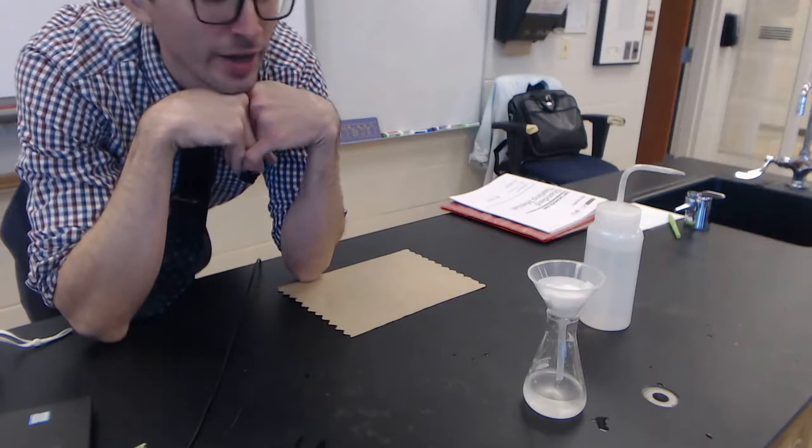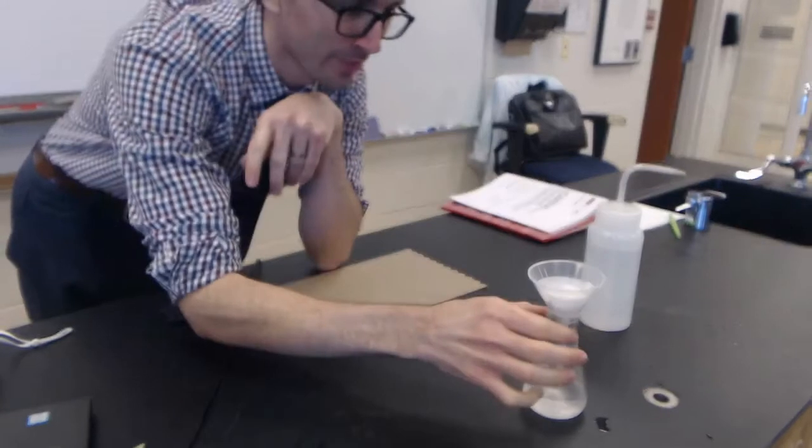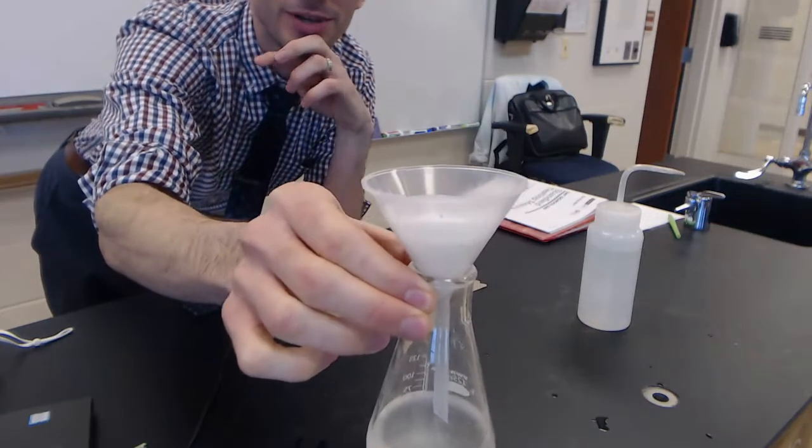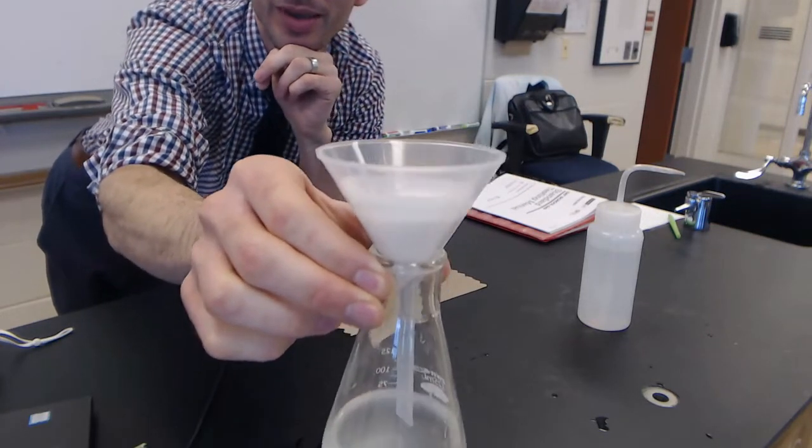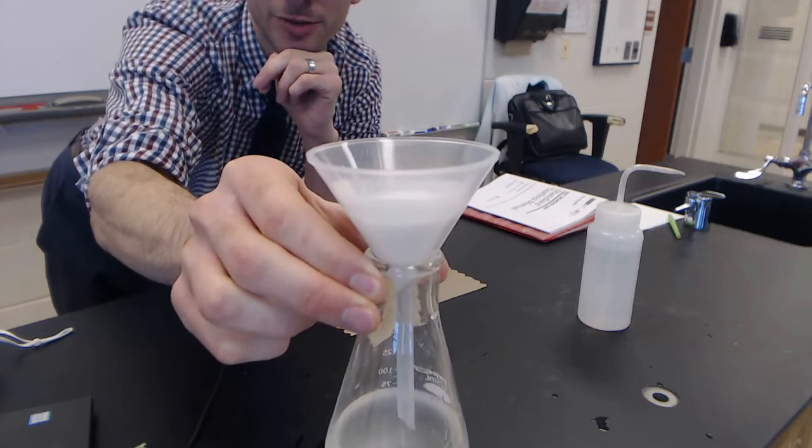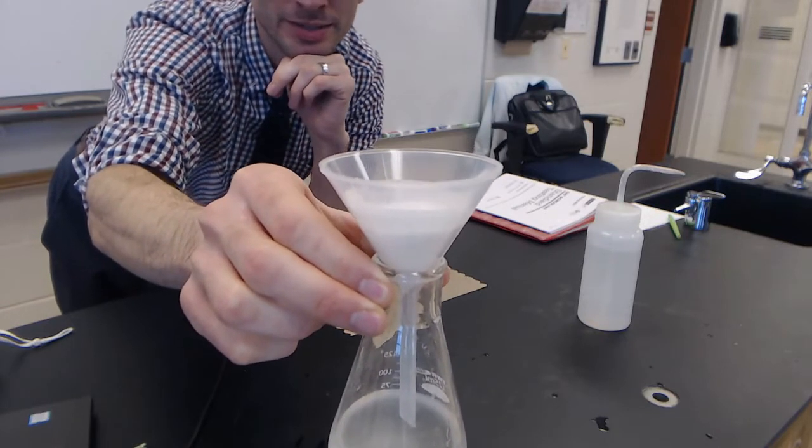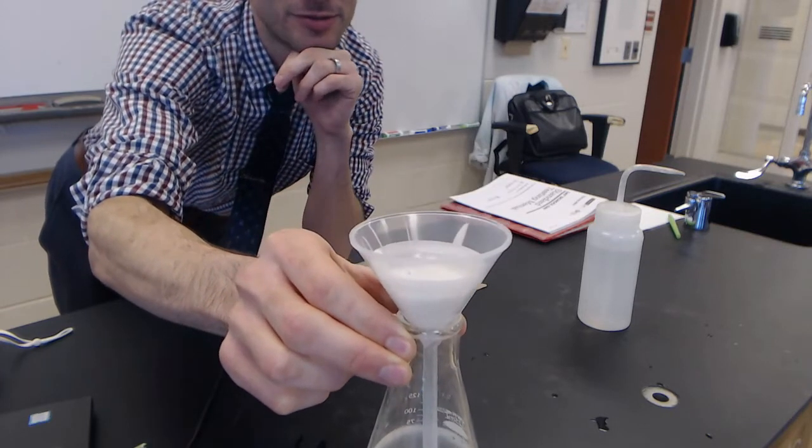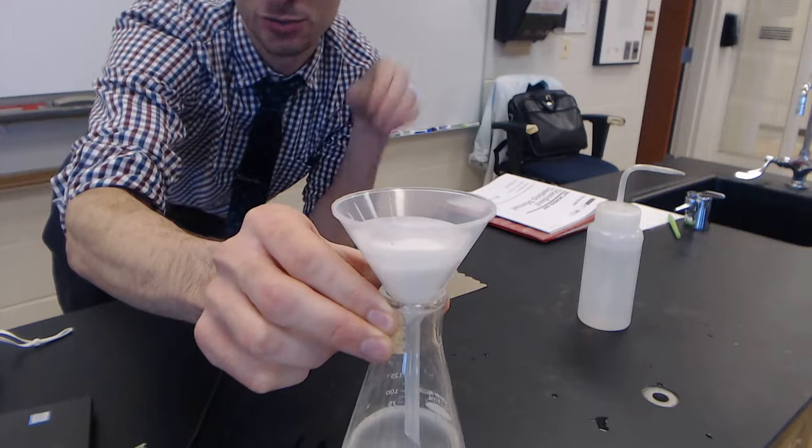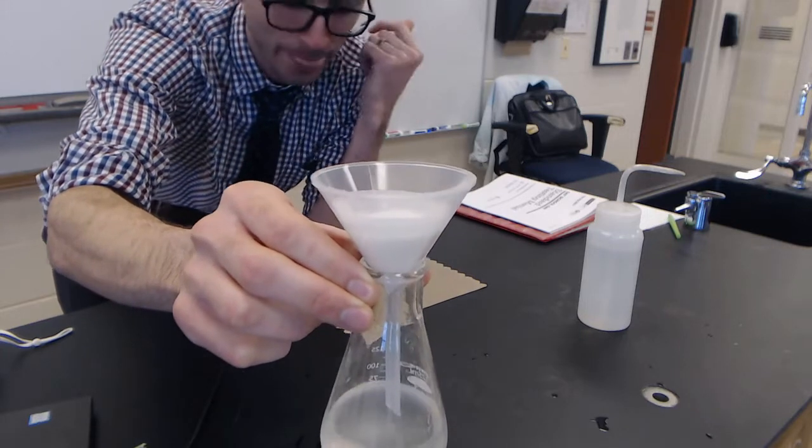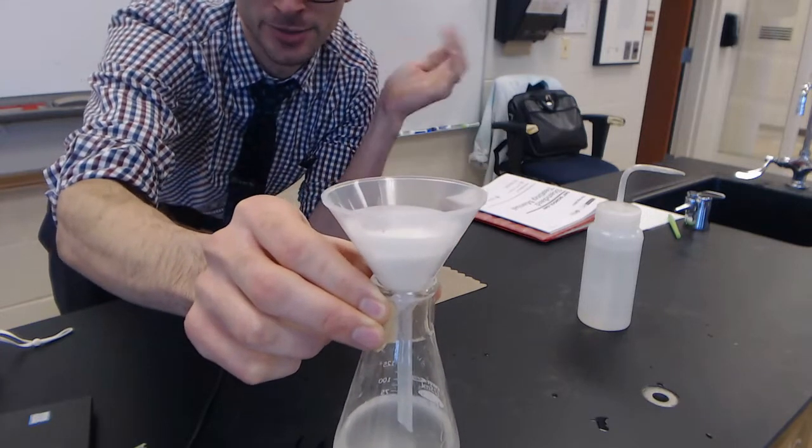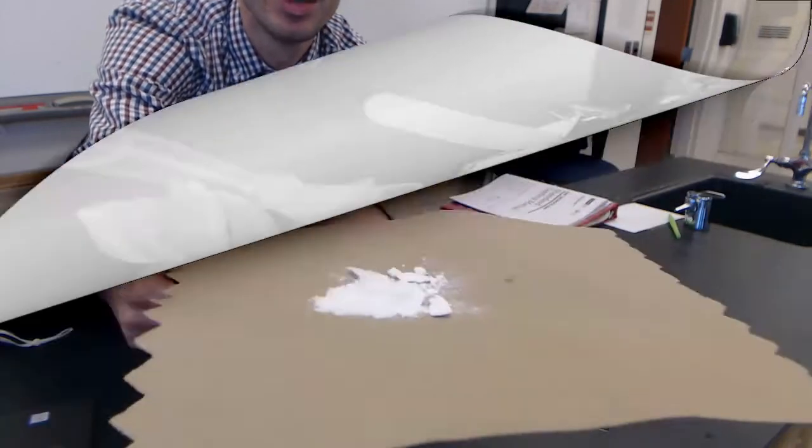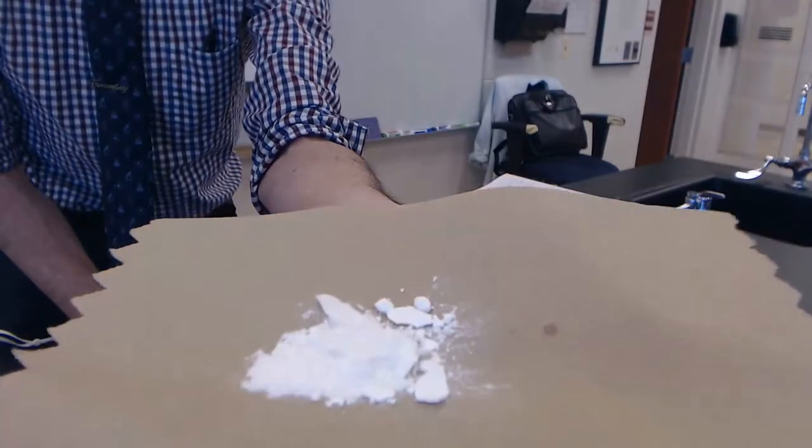I'm just going to fast forward to the way end. I am just slowly, carefully filtering out my precipitate. It's going to take some time, so I'm going to fast forward to when I get my dried precipitate onto a paper towel and then I can weigh it out. There we go, there's our precipitate at the end.